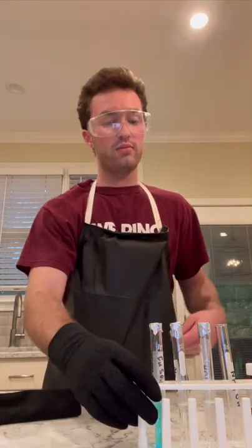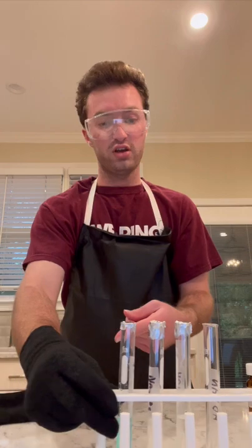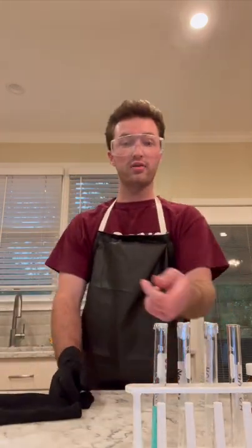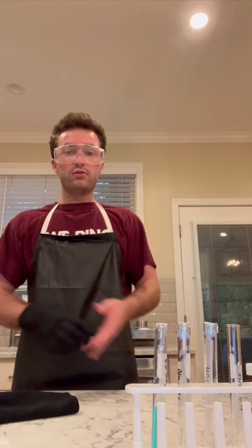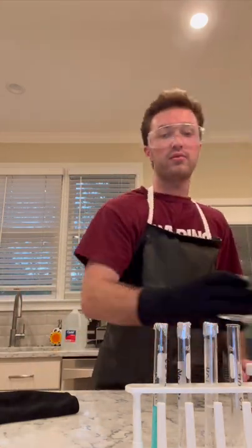Also, I don't know if I mentioned in the last one, but I did store my HCl properly. I sealed it with aluminum foil, and I have been for the last 3, so I apologize if I haven't been showing those. But for this next one, we have the ammonium hydroxide, essentially the same thing as our last one.